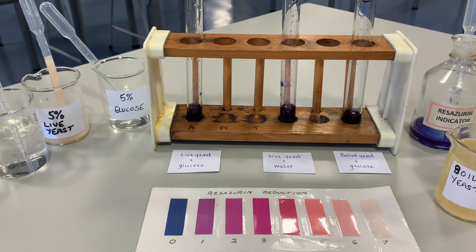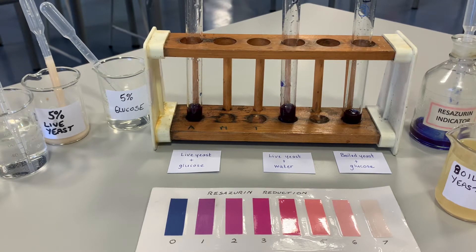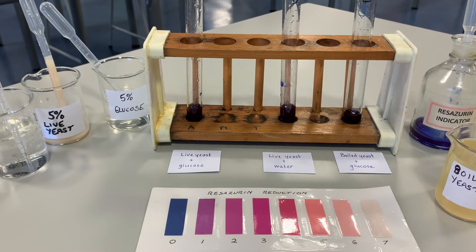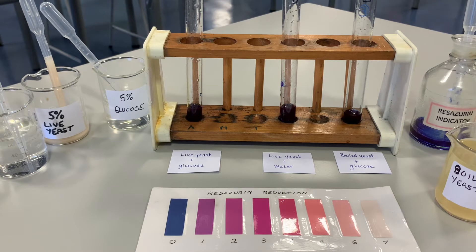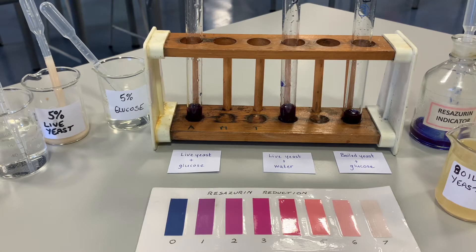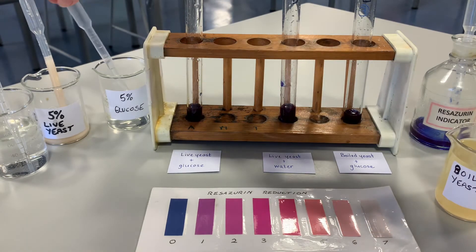Eventually, when it's got lots and lots of hydrogen present, it should go colorless. We're going to set up one test tube with live yeast and glucose, one with live yeast and water — the purpose of that control is to show that live yeast doesn't produce hydrogen without glucose — and then one with boiled yeast and glucose. When you boil a living organism you kill it, so it can't respire, and boiling denatures the enzyme.